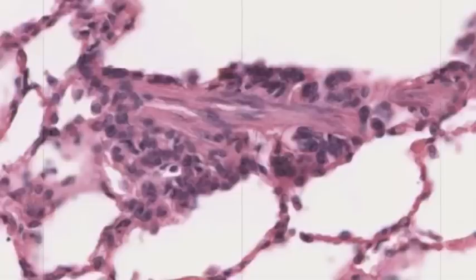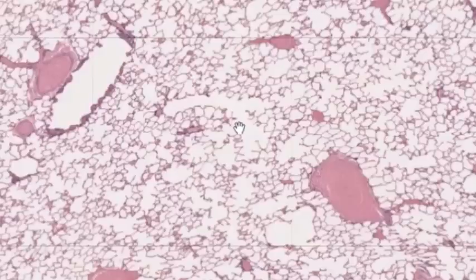To summarize: if it has cartilage it's a bronchus; if it has a distinct wall but no cartilage it's a bronchiole. The respiratory portion of the airway is defined as that portion across which gas exchange takes place, including the terminal ends of respiratory bronchioles. The other structures are alveolar ducts and alveolar sacs. Here we see an alveolar duct — air passes down this space and then moves into grape-like clusters of alveoli, across the walls of which gas exchange takes place.